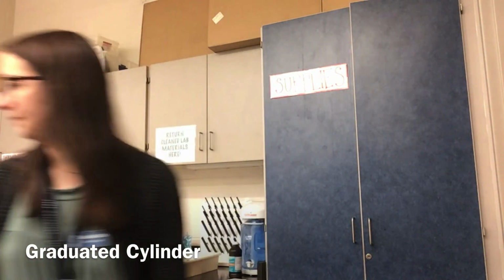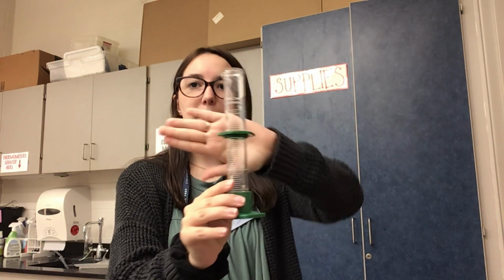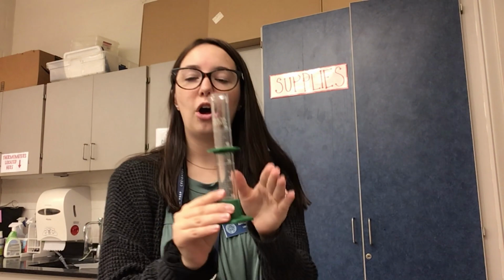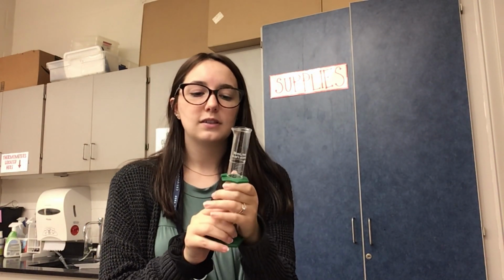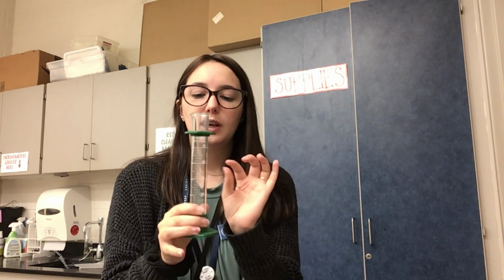Number three. Graduated cylinder. We've dealt with these a lot. We use them to measure volume. These are glass. This is a 50 milliliter graduated cylinder. These are used so that if it tips over, it's safe, it won't break. You just might lose your substance inside, so be careful with that. These are more accurate for measuring volume because I can go by the ones and I can have an estimated digit into the decimals place. Again, this is one that we will use a lot in lab.